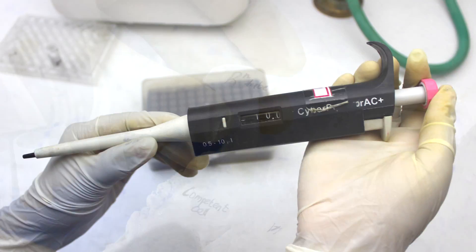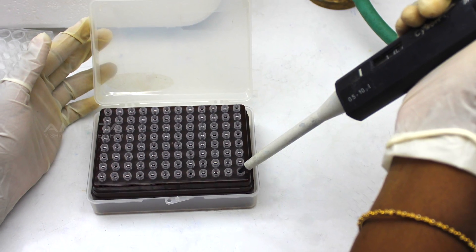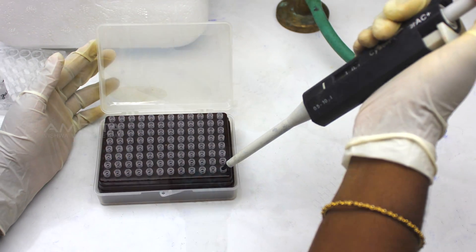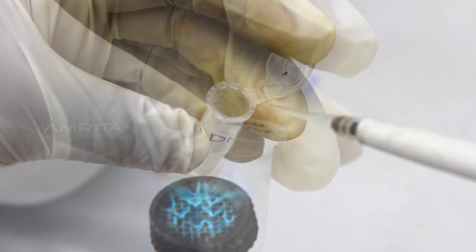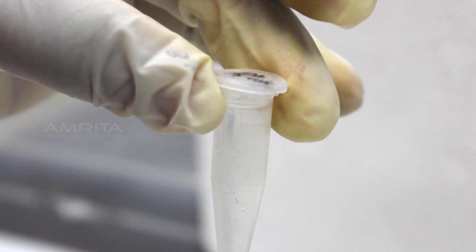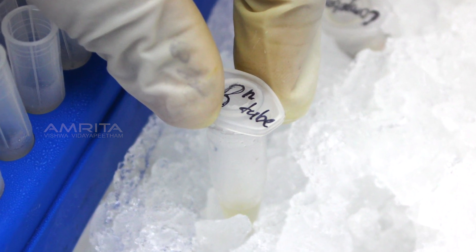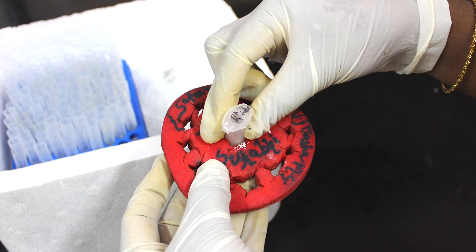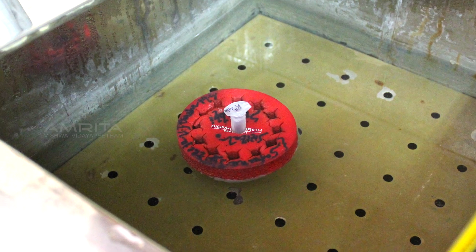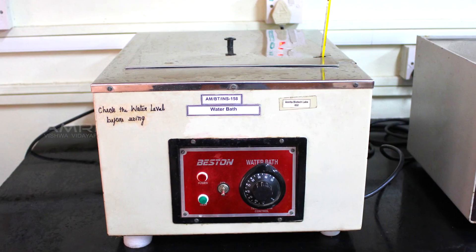Take the 10 µL micropipet, insert a fresh micropipet tip into it, and transfer 10 µL of DNA to this microfuge tube. Store the tube in ice for 30 minutes. Now place the tube in a floater and keep it in the water bath at 42 degrees Celsius for 95 seconds.